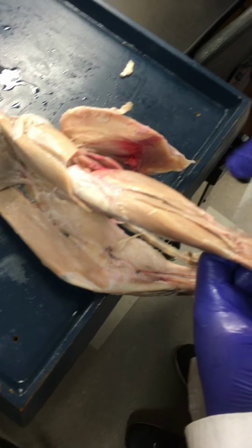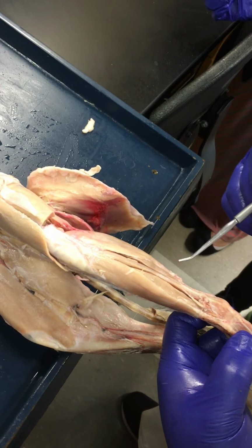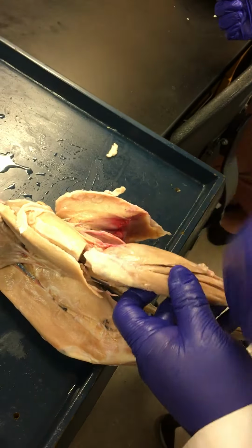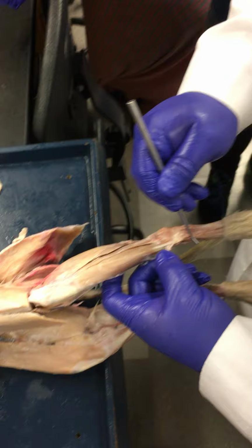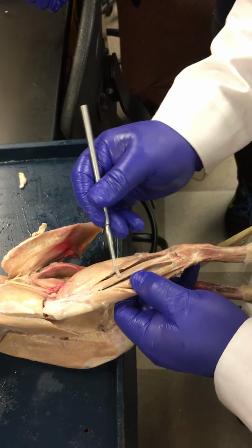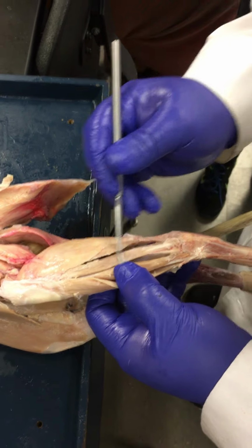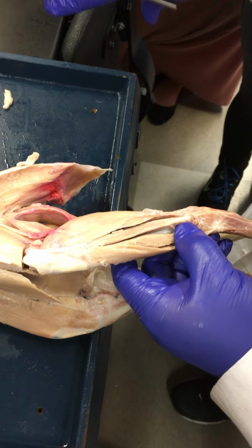As you go posterior to that, the next muscle visible here is going to be your extensor digitorum. You should be able to see this large visible tendon right there, extending towards the digits, right? And of course, as the name implies, this guy's going to extend those digits. Moving on from there, the next major muscle that you're going to see here, associated with this visible tendon here, is the fibularis longus, or the peroneus longus. And this guy's going to function to evert the foot, take it sideways.